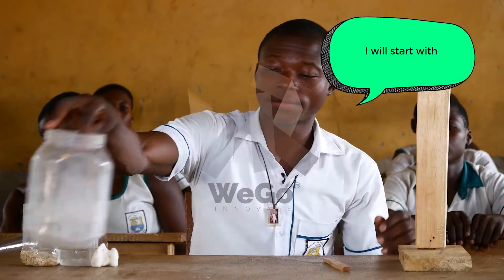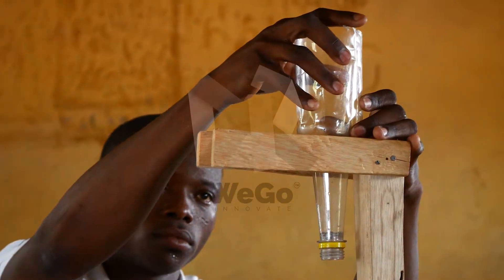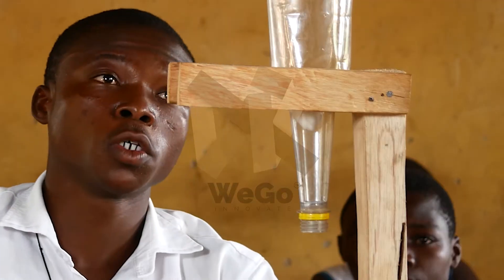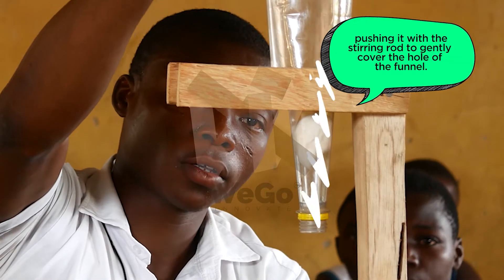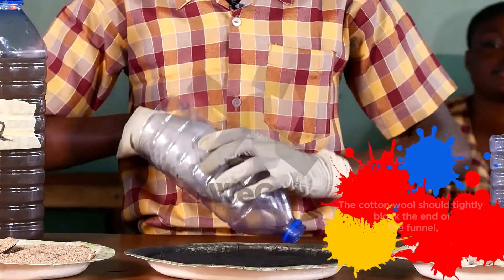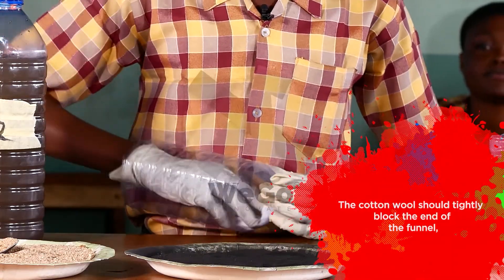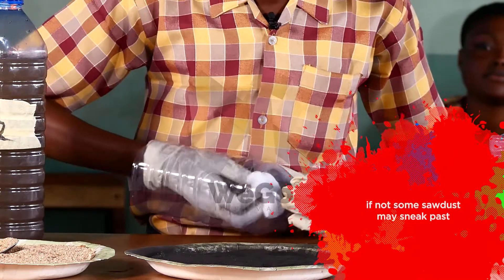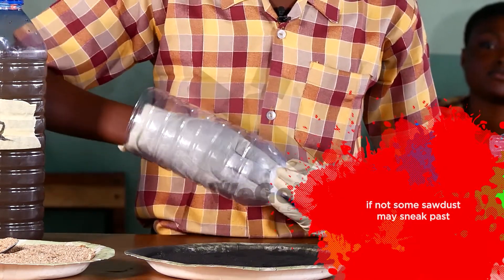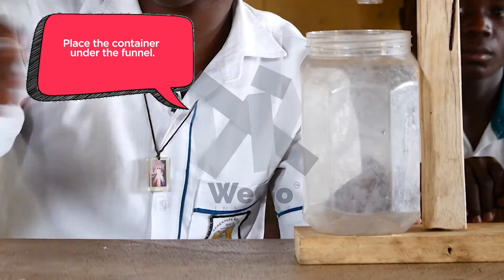I will start by putting the cotton wool in. Use the stirring rod to push it to gently cover the hole of the funnel. The cotton wool should tightly block the end of the funnel. If not, some of the sawdust may sneak past. Place the container under the funnel.